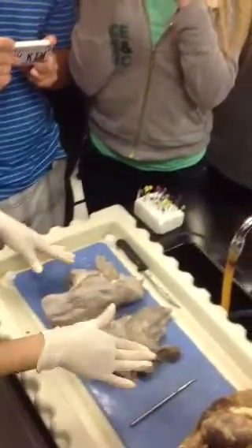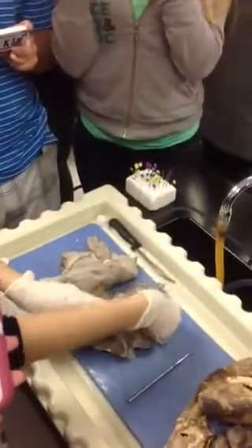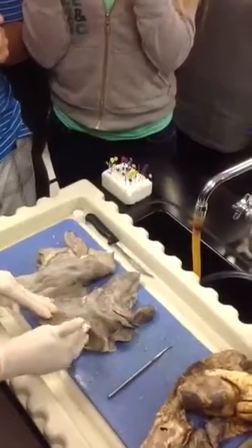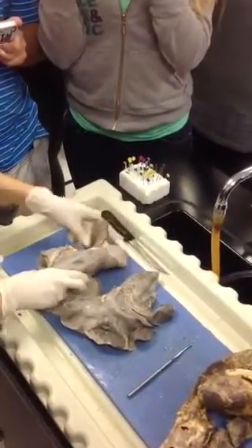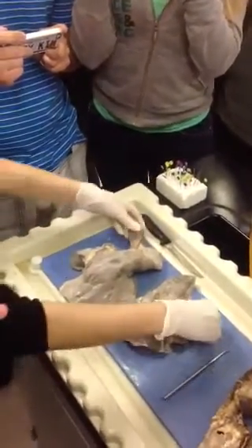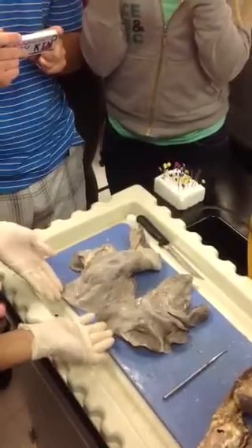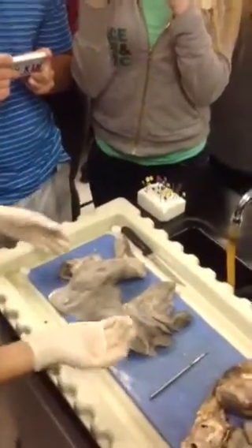This is the ventral side. Is this right or left? Left. Left, and we know because it has two lobes. 1, 2. Is this the right or the left then? This is the right. 1 lobe, 2 lobes, 3 lobes. And for sheep, it's smaller up top, larger at the bottom. Versus humans, where it's larger up top, smaller at the bottom.